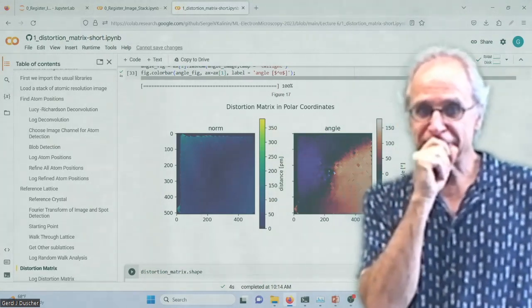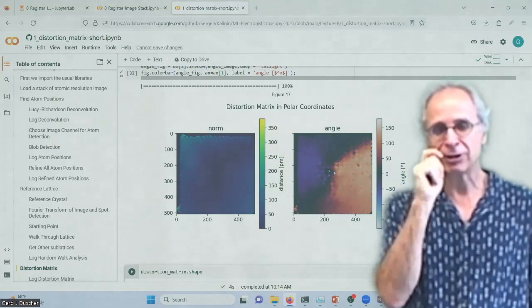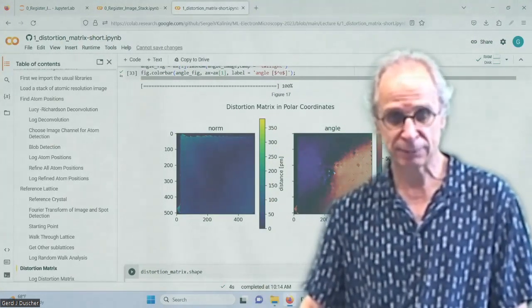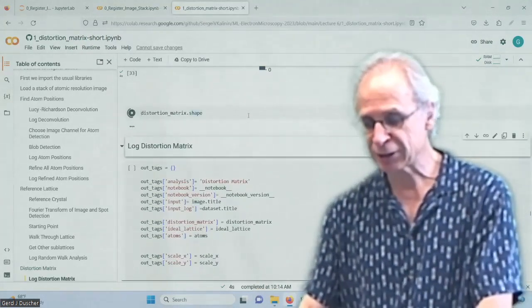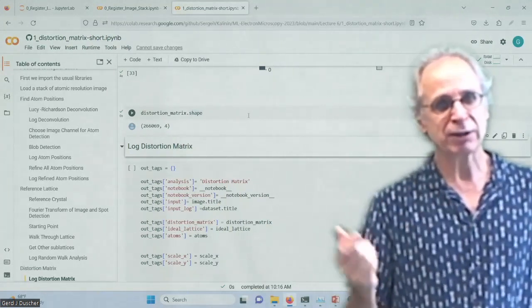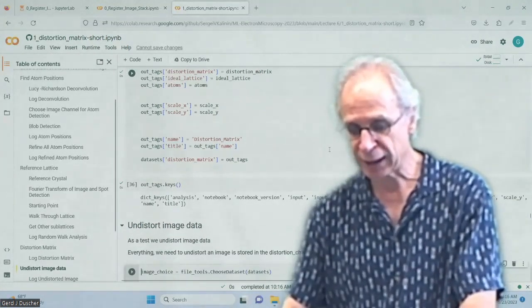In the very first lecture I gave, so lecture 2, I told you it's very important to determine which one is the fast and the slow one. And you can see now why, right? So we have to be very careful, flipping that would make the whole thing more difficult. The deformation matrix, for each pixel, which is 2 dimensions, gives you another pixel, which is another 2 dimensions. And if you use that deformation matrix, you can undistort your image.